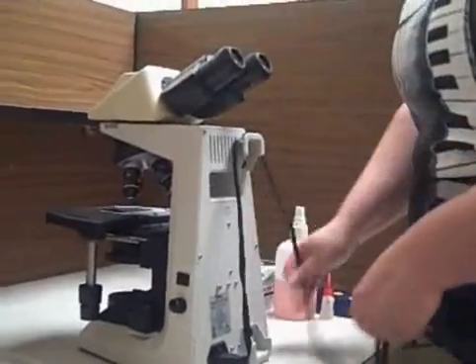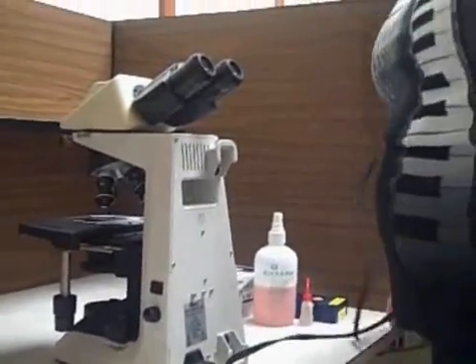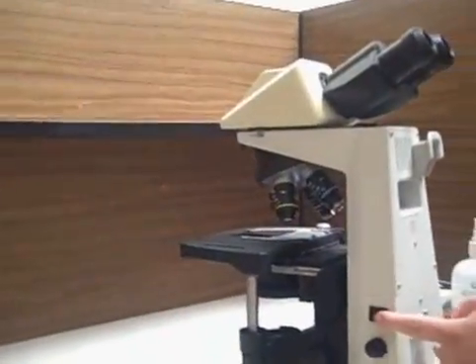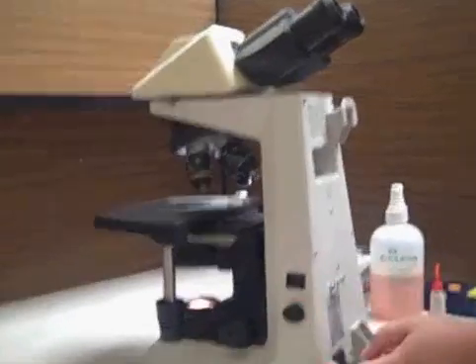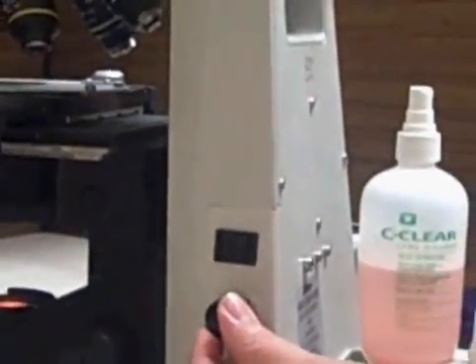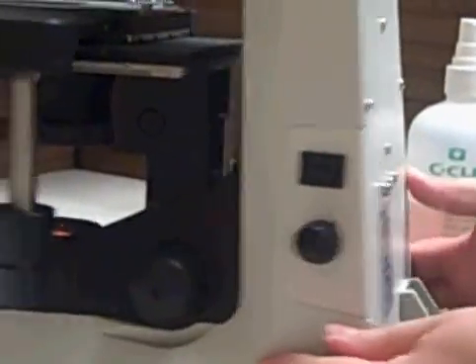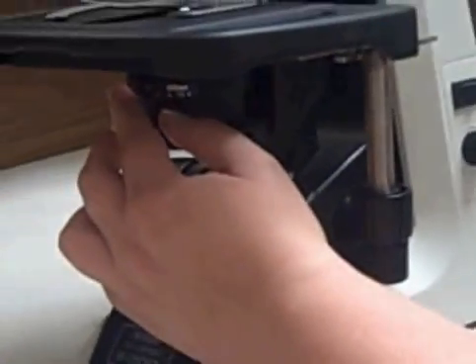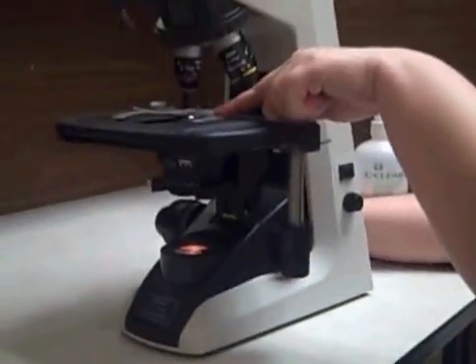Next, we're going to show you how to set it up. Plug it in, turn on your switch, adjust your light to like midway through and possibly adjust your filter if it's completely closed. So you have a nice bright light bulb.